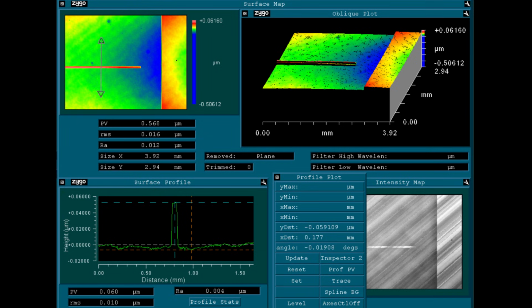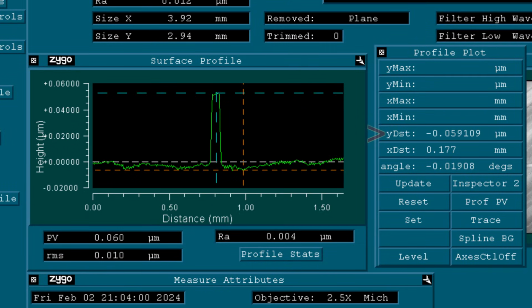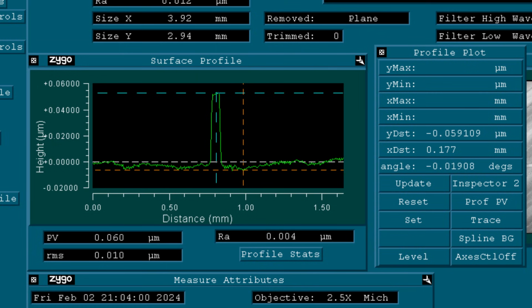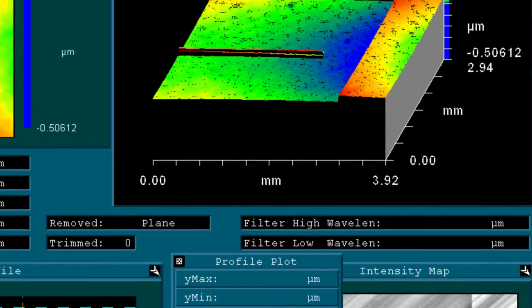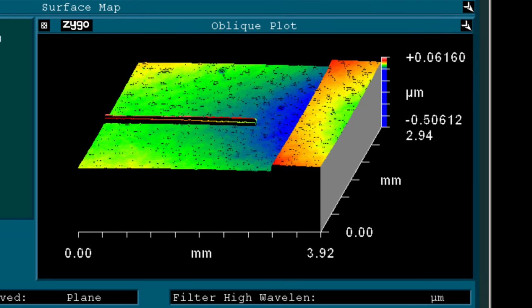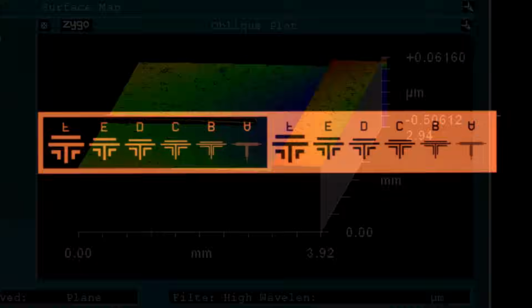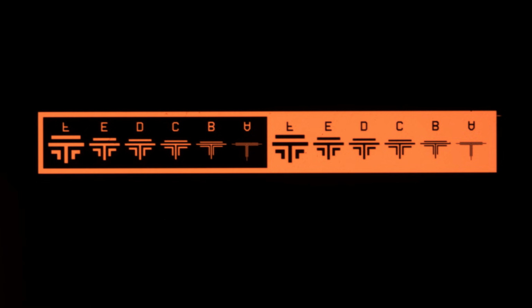We can now from these data easily measure the step height of the chromium layer with the software, and if we do that we find a value of 59 nanometers, which agrees quite well with what we expected from the experimental setup. Now, even though the height resolution is quite mind-boggling, the lateral resolution over the surface, so in the X and Y direction, is quite limited due to the low magnification of the objective and the low resolution of the camera. So if we want to take a look at smaller details like those found in these test features in the chromium, we need to use a higher magnification objective.